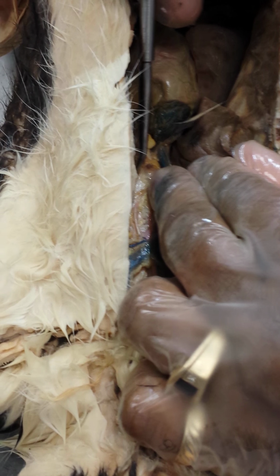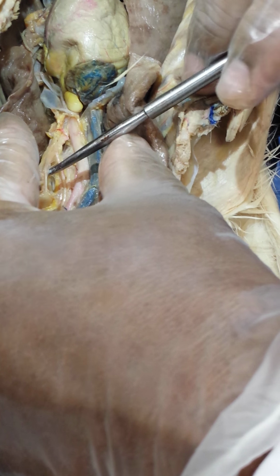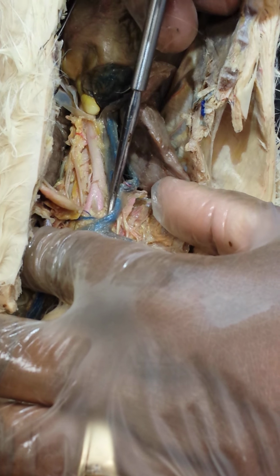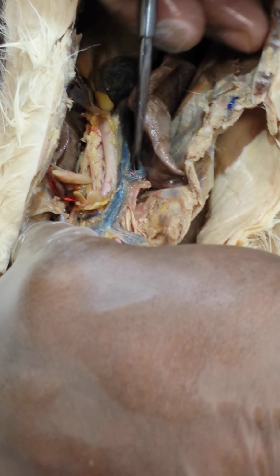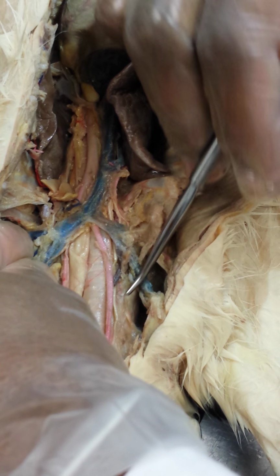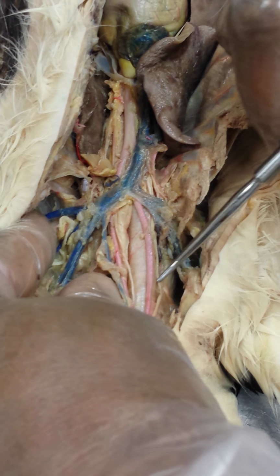And on the left side, a smaller vessel, which is just simply your subclavian. Okay, that's your subclavian artery. So on the right, you have your brachiocephalic, which will give you your subclavian branch and your carotid. Your right carotid. On the left side, you will have your left carotid, and they both straddle the trachea, and deep to the trachea is your esophagus. These are your common carotids.